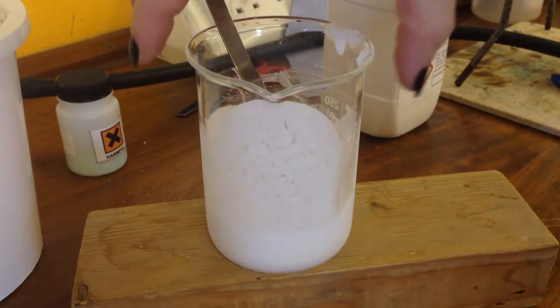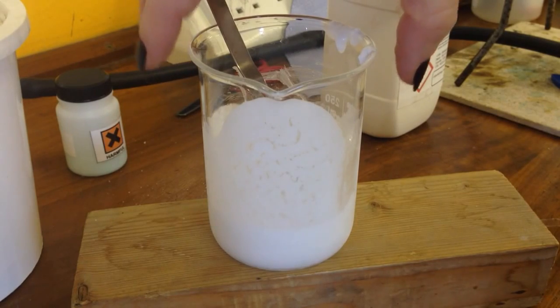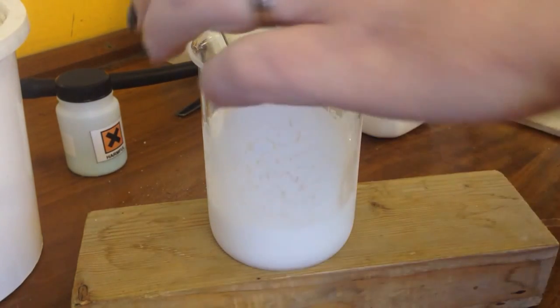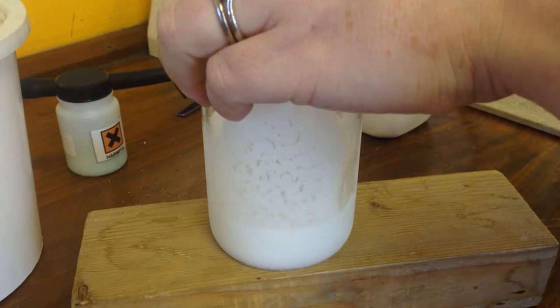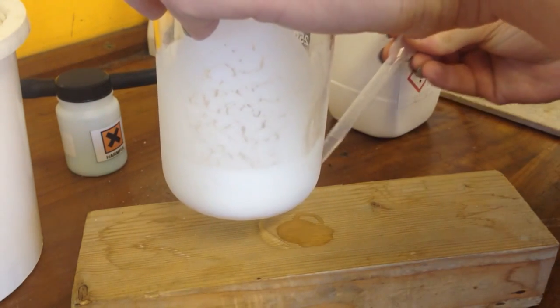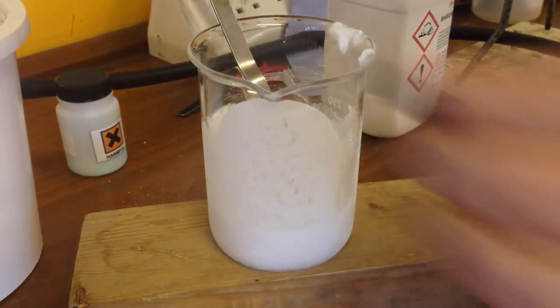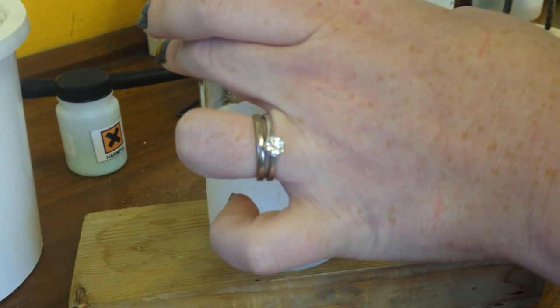Put the mixture back on. And then hopefully I should be able to lift up. Not quite yet. I should be able to lift up the beaker with the bit of wood, using a bit more water under there maybe to help it out. Give it a bit of a stir again.